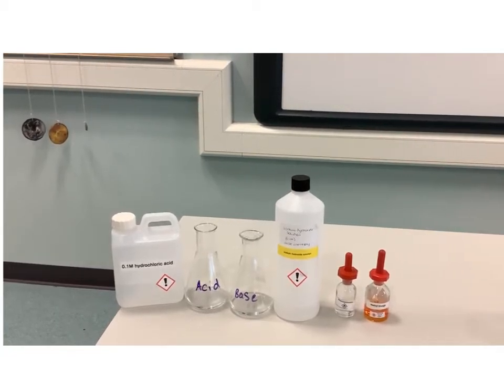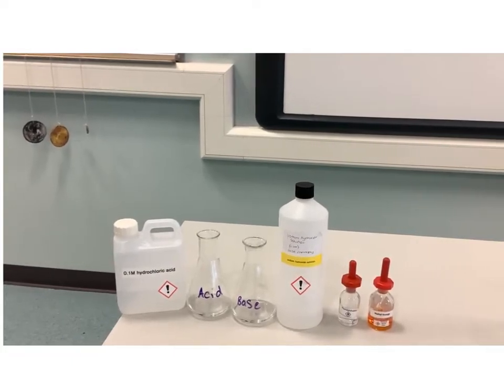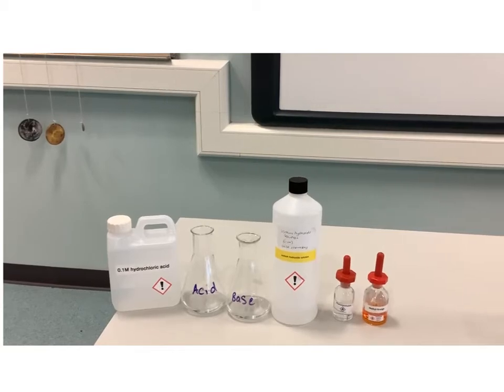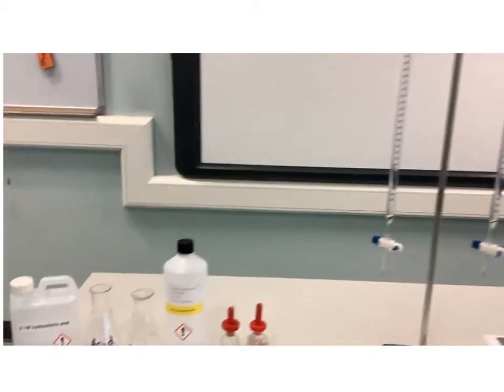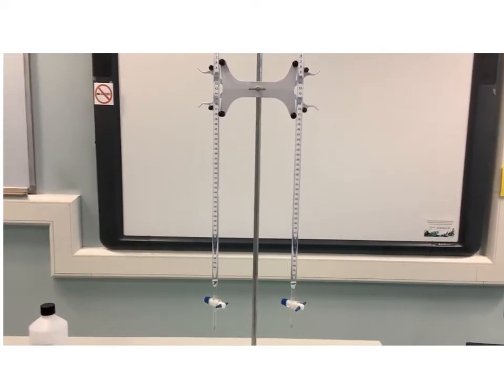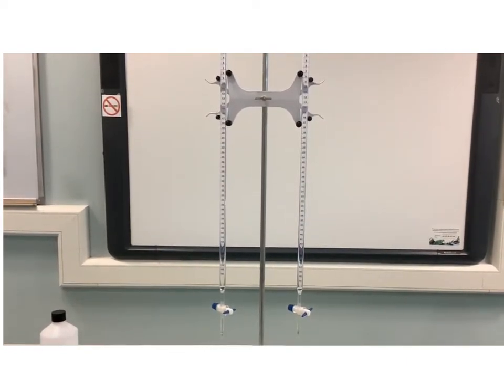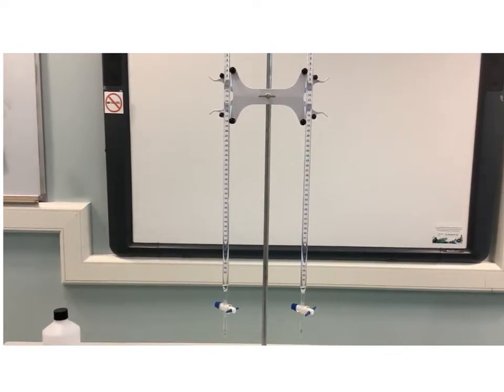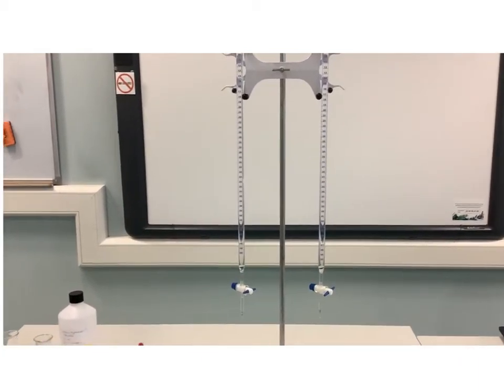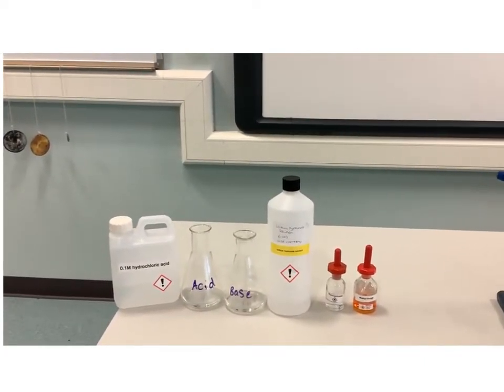I'll start with acid in the conical flask and add the base to that — sodium hydroxide from my burette. You can see I've got my burette set up: on the left-hand side it is filled with hydrochloric acid, and on the right-hand side it is filled with sodium hydroxide, the base. For each of the color change demonstrations I will be adding the opposite solution to the conical flask.